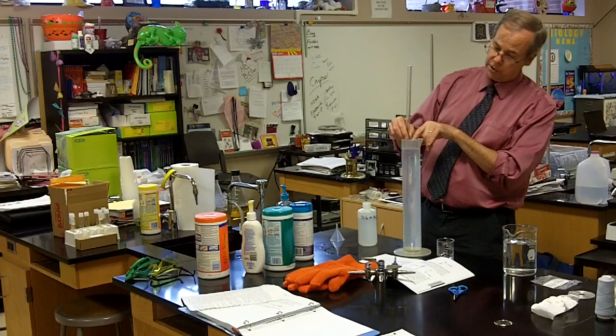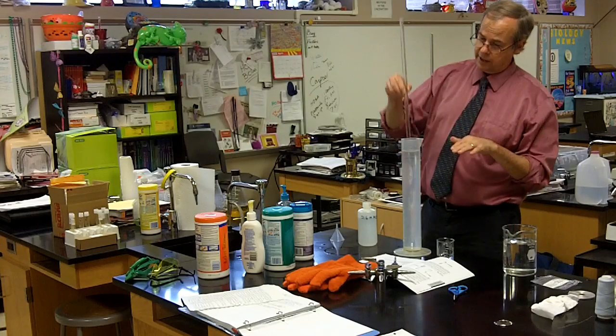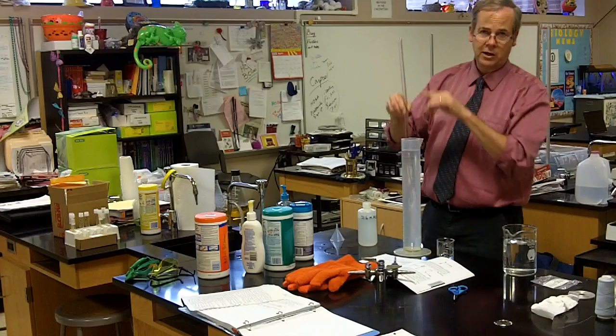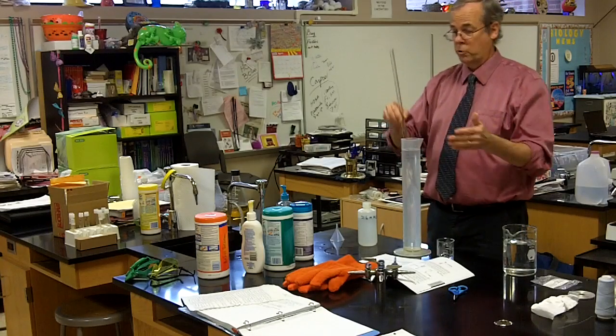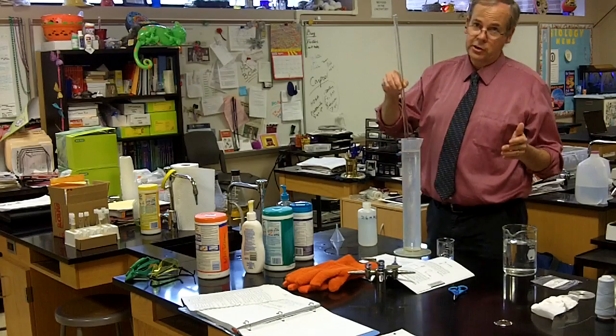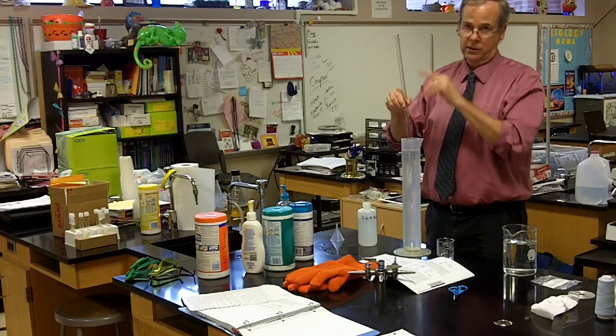And this is the volume I want to measure, where I know the pressure. Because if I raise and lower this tube, I notice the volume keeps changing. And that's, of course, according to Boyle's law. We're increasing and decreasing pressure by doing this. And so we're decreasing and increasing our volume.